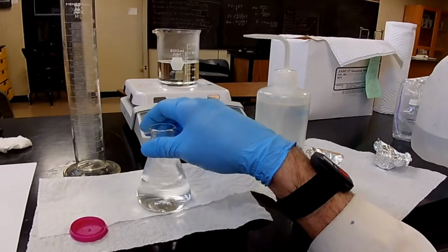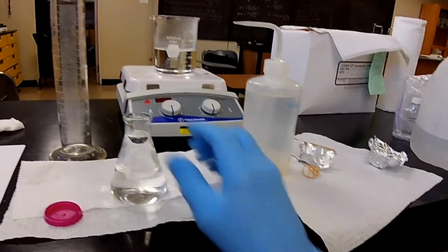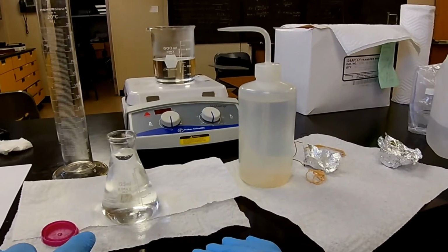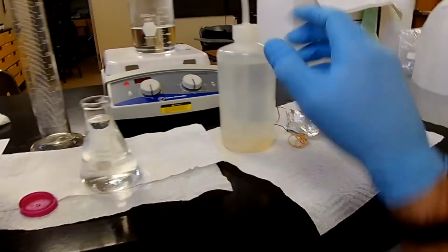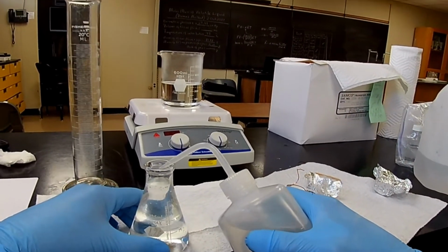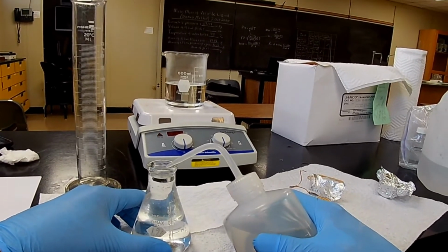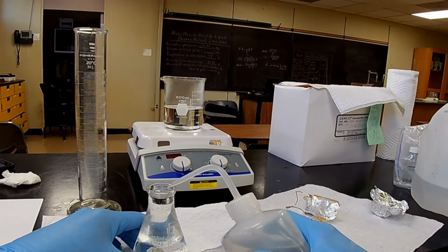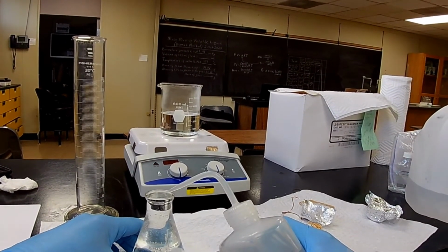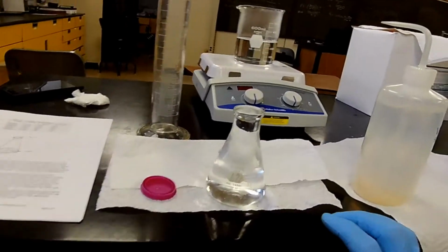I don't think we have enough bubbles in there to add any more uncertainty than we're going to get from that measuring device. So let's fill it up, and we want to fill it up right to the brim, because that's where the inner aluminum foil was situated. All right, a little more. There we go. Right to the brim.